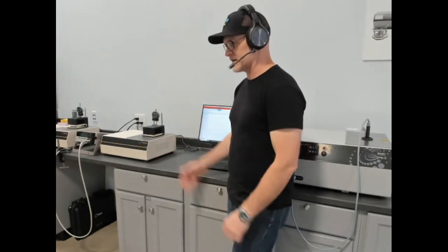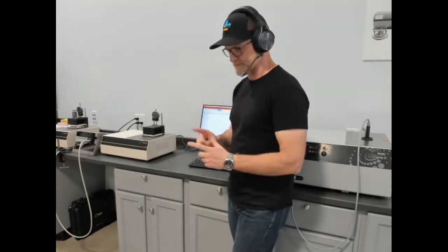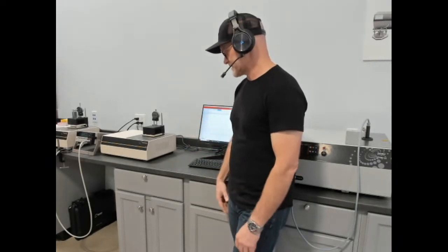You want to characterize those with the proper method. So we designed a heat flow meter to allow you to test samples as small as 2-inch square and thickness range of a few millimeters up to 25 millimeters thick.